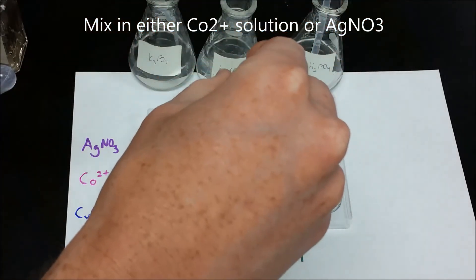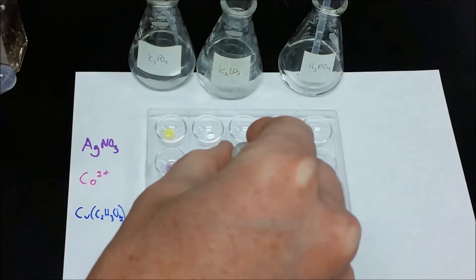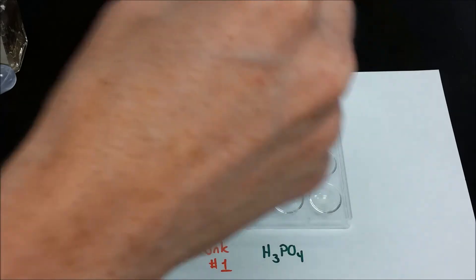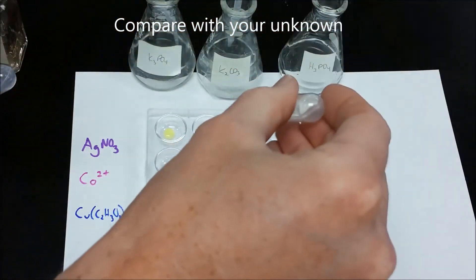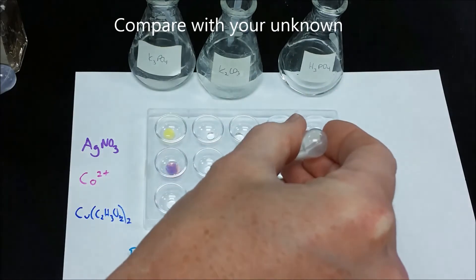If we compare that to an unknown, we should get different results even if they're the same precipitate. However, if we do phosphoric acid, it won't work.